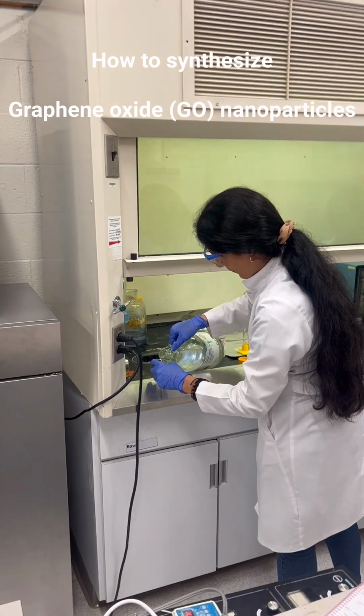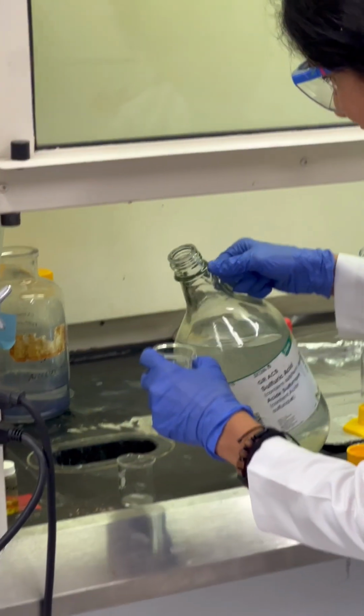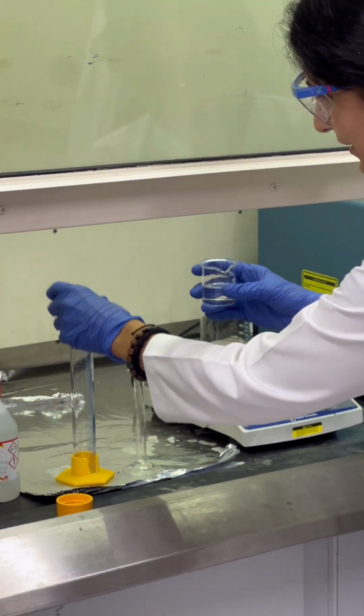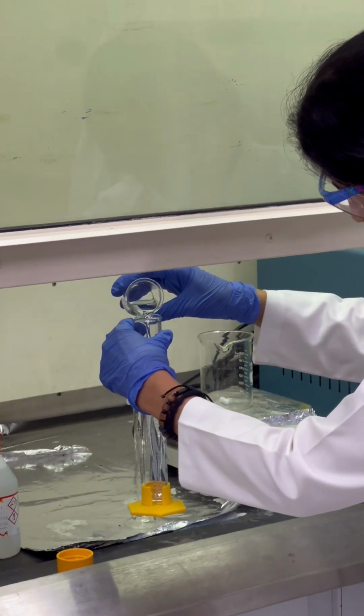And then I do it, and you can see it's very easy. How much sulfuric acid are you adding now? 27 milliliter. 27 milliliter. Yeah.